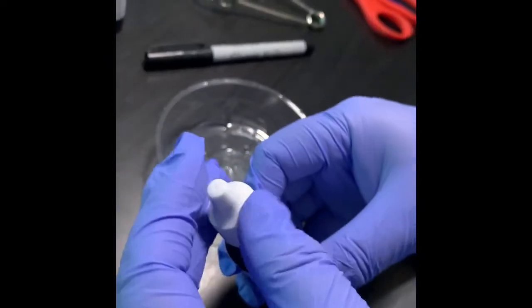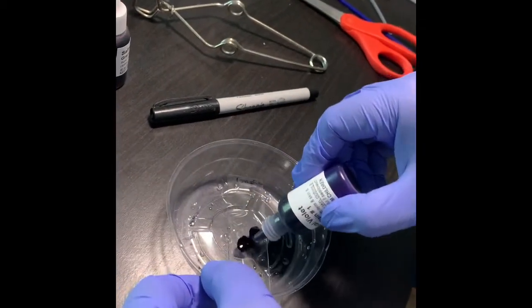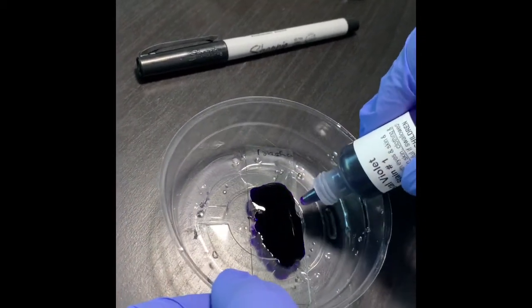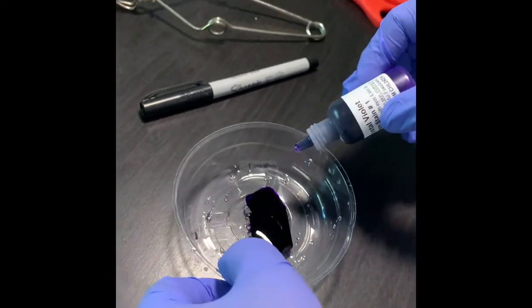So I'll apply the crystal violet in such a way that it covers the smear properly. We say flood it with the crystal violet. So make sure that the rest of the crystal violet stays, because you have to do another slide.